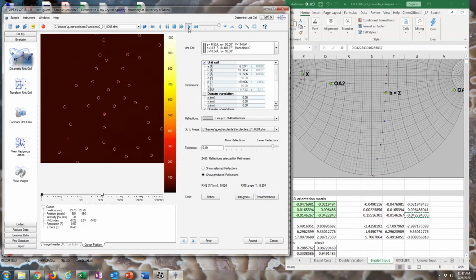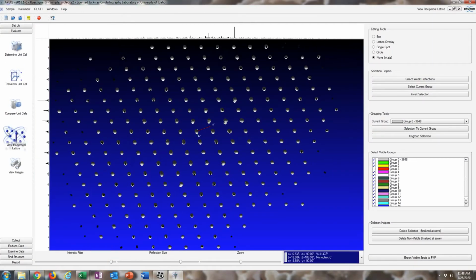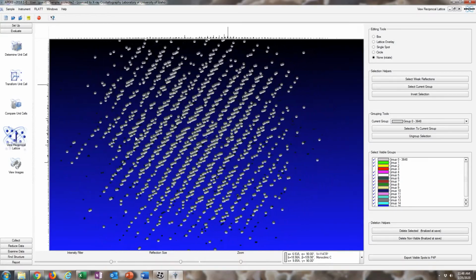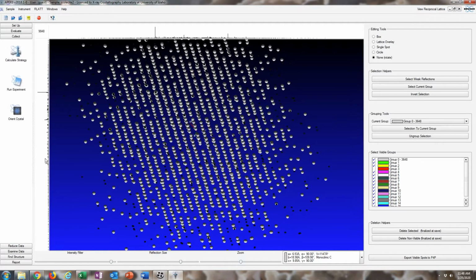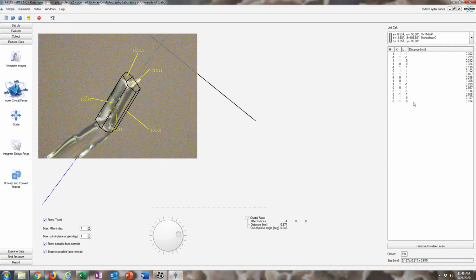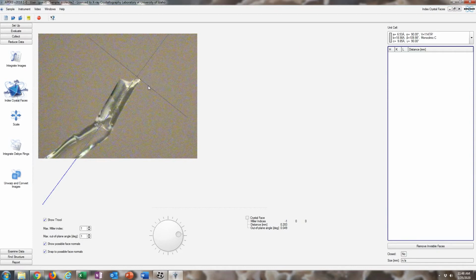Like I said, normally you wouldn't have to do any of that. Just find a lattice and then proceed to the next part. And if we look at our reciprocal lattice, there are our reciprocal lattice vectors, which look good. We can orient this and look down each axis. That looks right. And since it's monoclinic, of course, reciprocal lattice vectors are going to be a little bit confusing. And then I have to re-index these because it was done in a different lattice setting. So I'm just going to clear this and redo this.